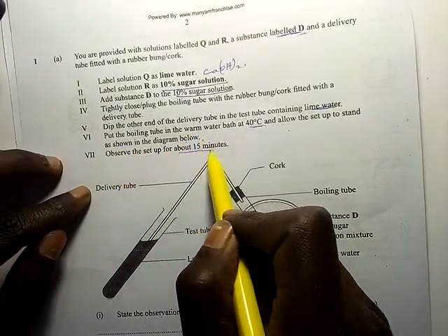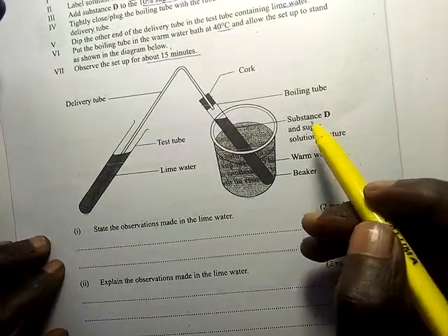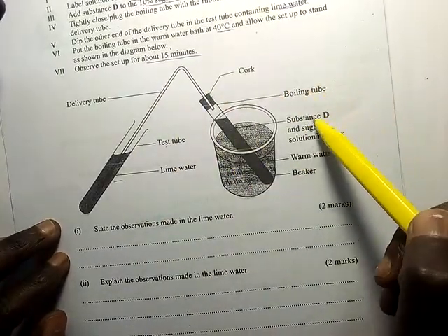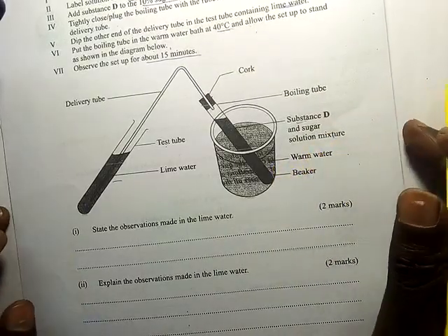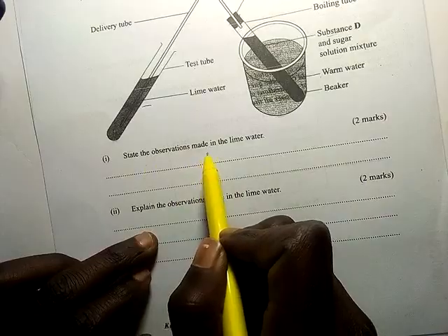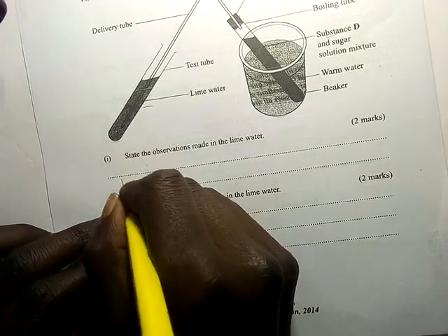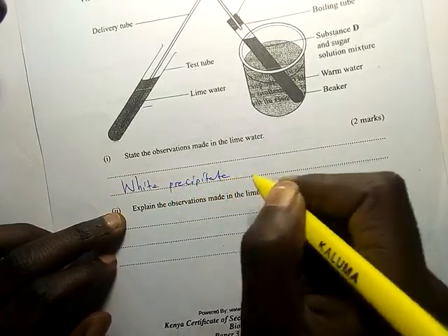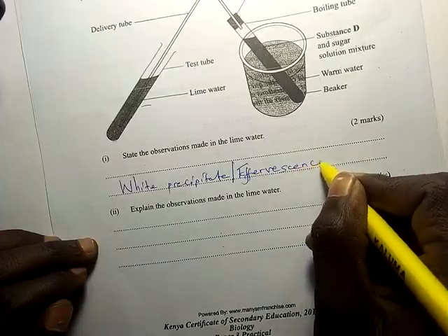Observe the setup for about 15 minutes. The setup looks like this: the lime water in the test tube, the delivery tube, the cork, substance D mixed with the sugar solution, and the water bath at 40 degrees Celsius. The observation made in the lime water was a white precipitate or effervescence occurred.